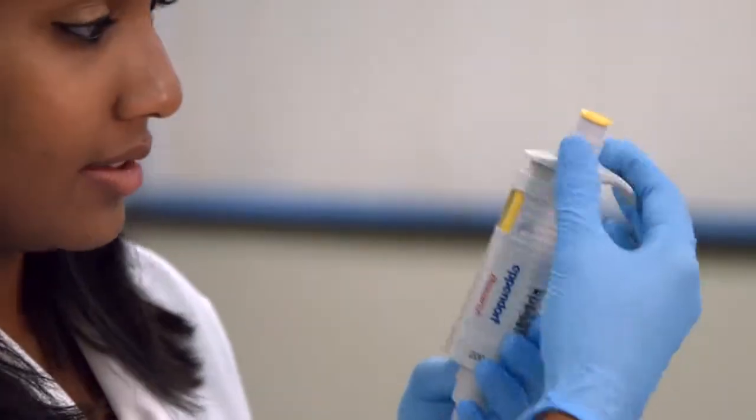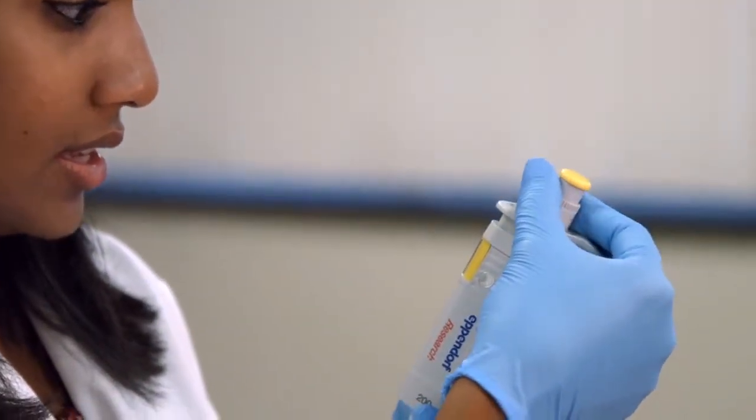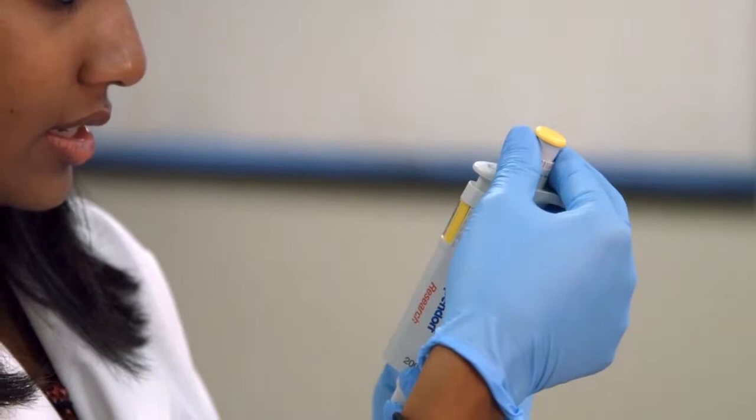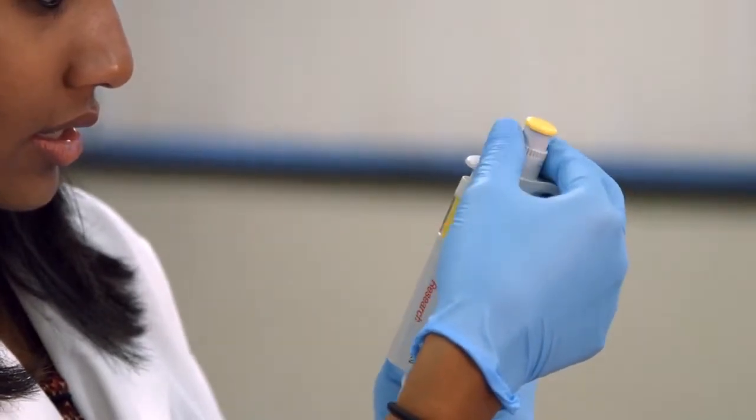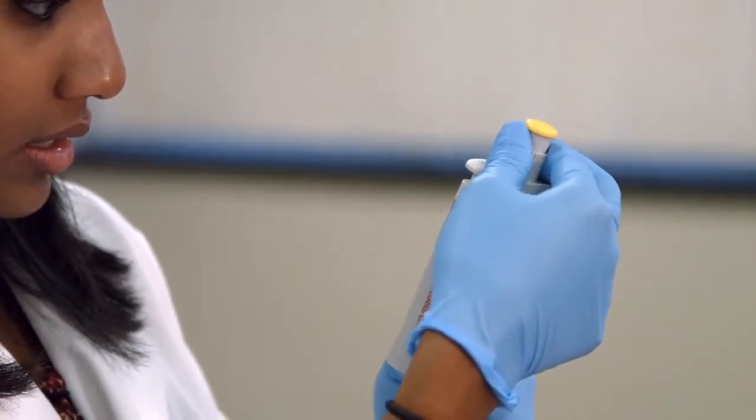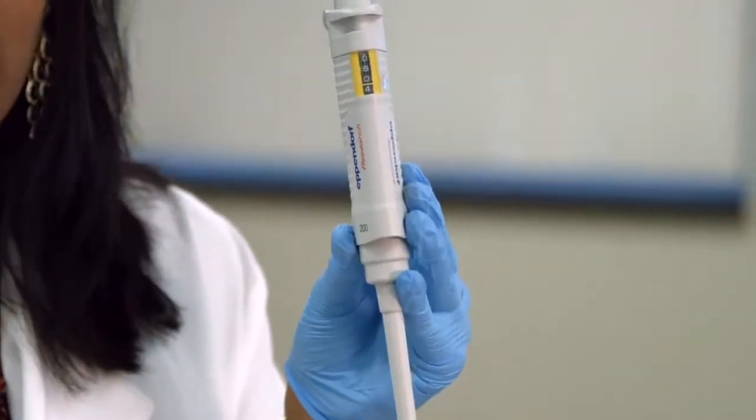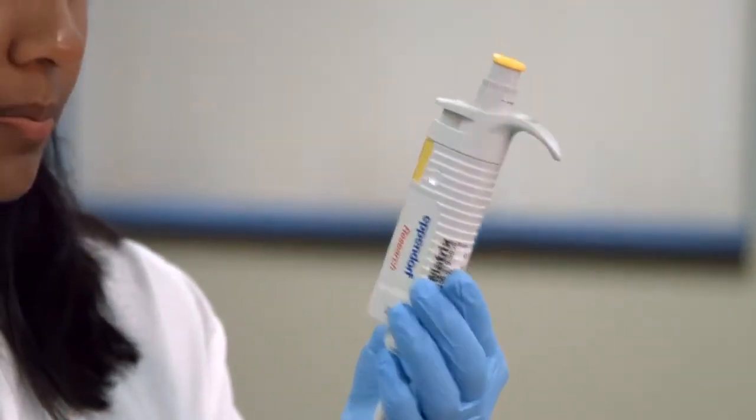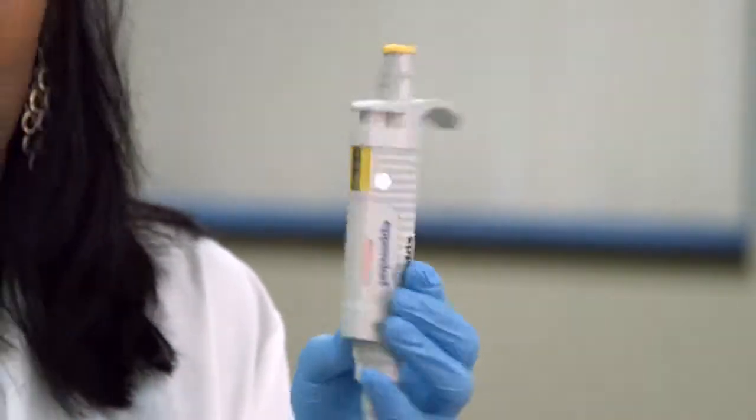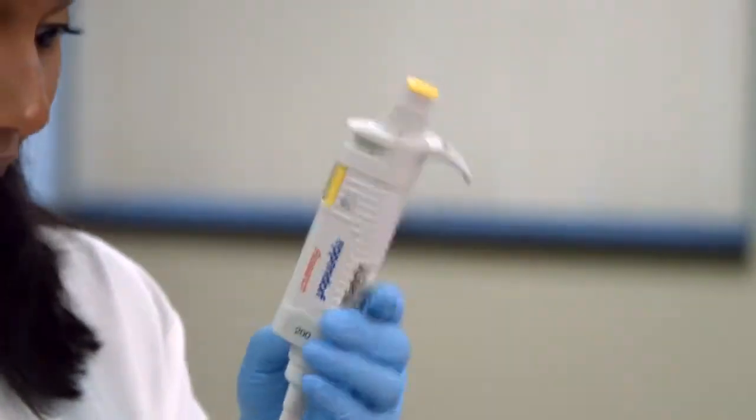So this is 80, and now this is 80.4 on here. I guess this goes up by increments of 2, but some of them do go by increments of 1, so that's why I couldn't show 80.5.